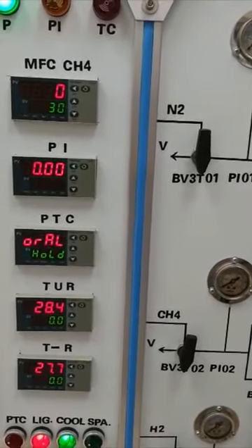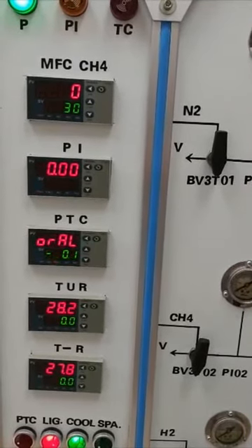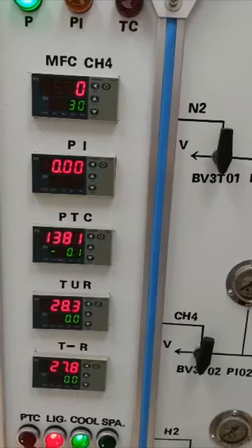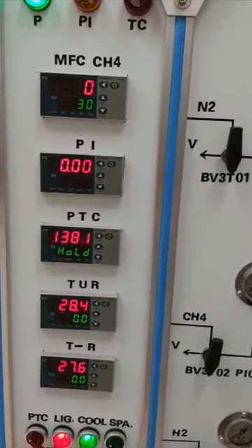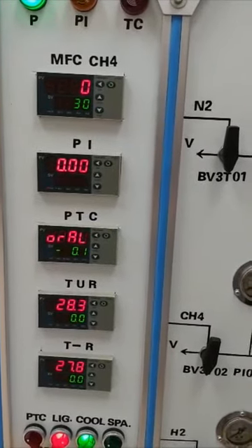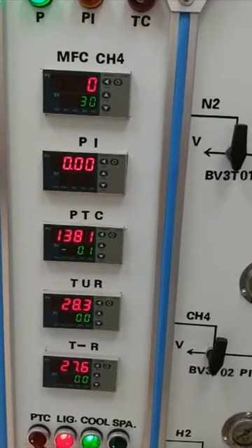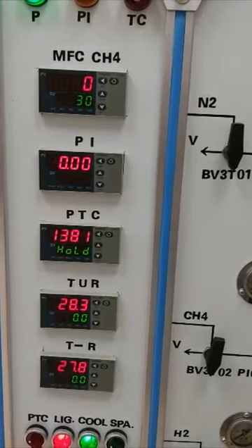The pressure indicator is also a spare part, in case your reaction will bear a pressure. But recently, because of limited budget, this system hasn't installed any back pressure valve yet, so the pressure indicator doesn't present any valid values. With the installation of a back pressure valve in future, this system can be used as a fixed pressure reactor.